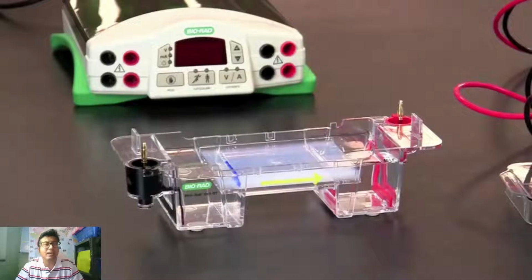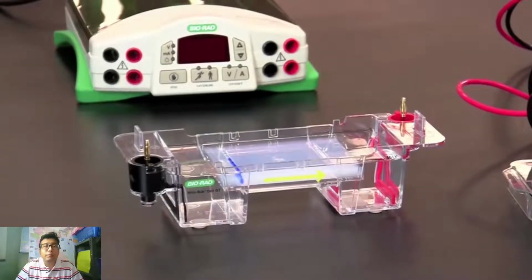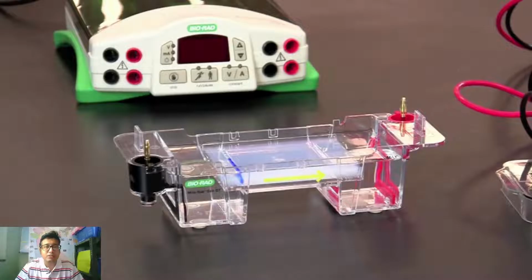This is very important. We should take care not to puncture the gel, or apply the sample in such a manner that it spills. It's a very delicate procedure, DNA gel electrophoresis. After it is done, we will not move. Make sure you don't bump the whole thing. It should be very stable so that it will not spill.